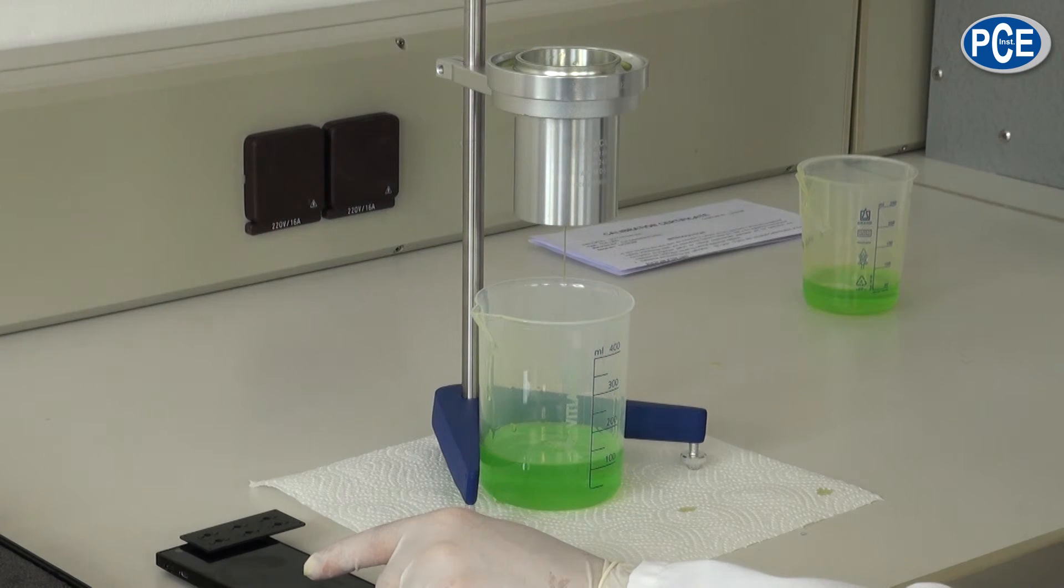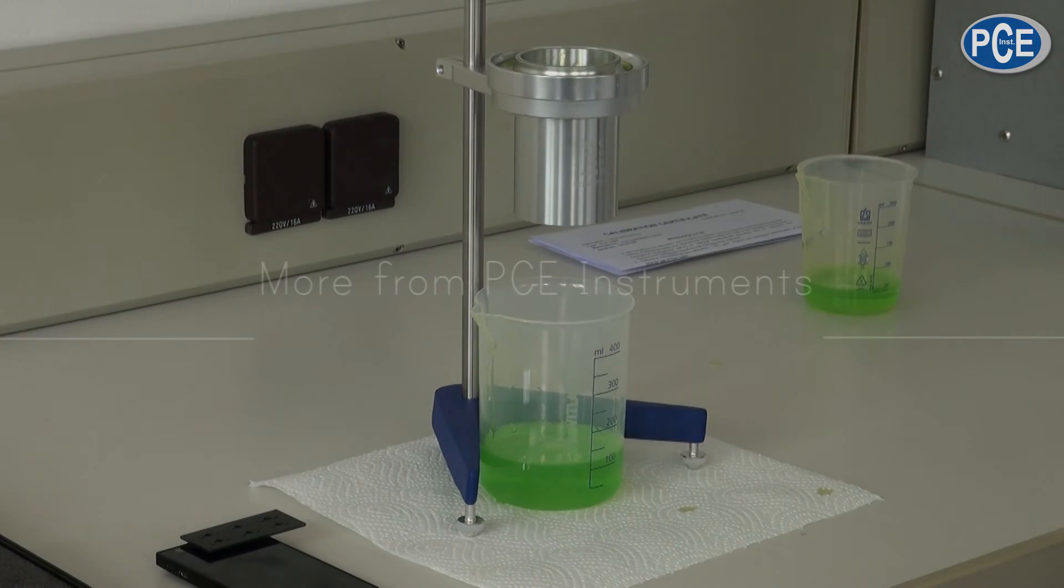When the fluid stops flowing, the time is determined and the measurement is finished.